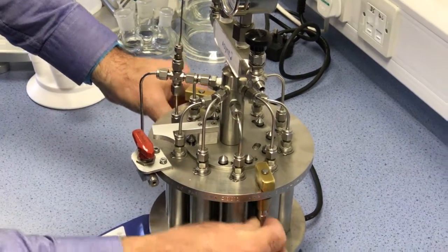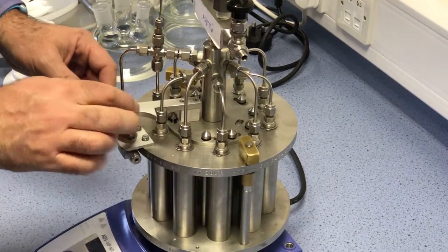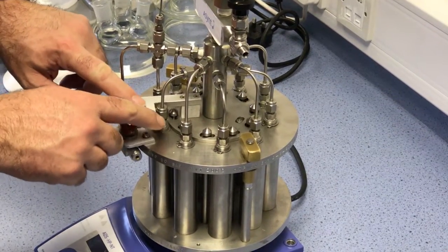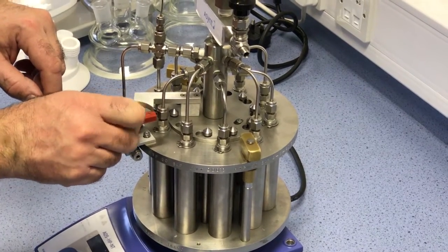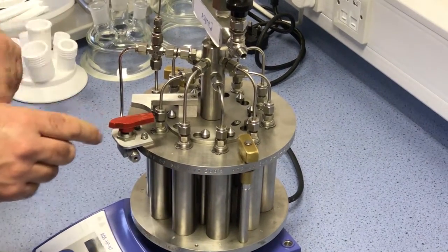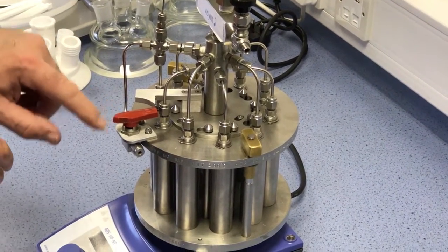These are designed to take the full strain of the pressure. This locking plate is the key part. So that needs to be turned to the left. The lock valve opened or closed I should say. This will stop it from being movable here whilst there's still pressure applied.